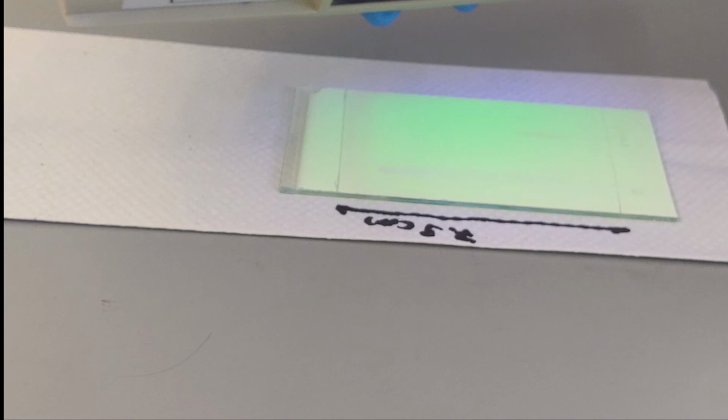After your TLC run is done, you can go on to record the data from the TLC like we performed in the first TLC experiment under short UV light. And finally, move on to take the infrared spectroscopy measurement of your product.